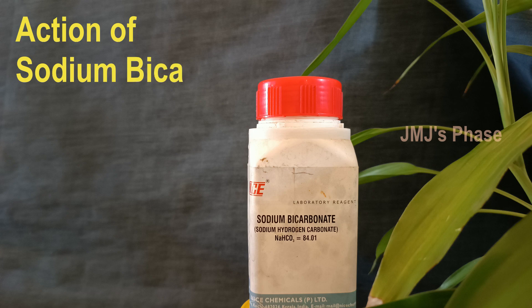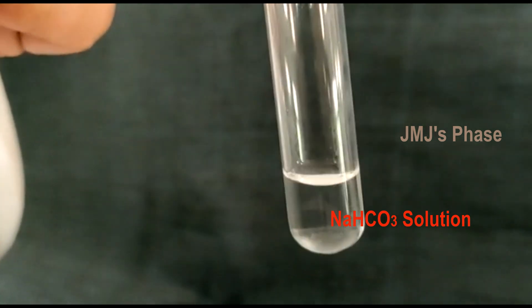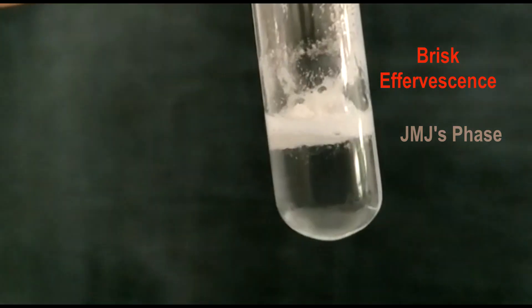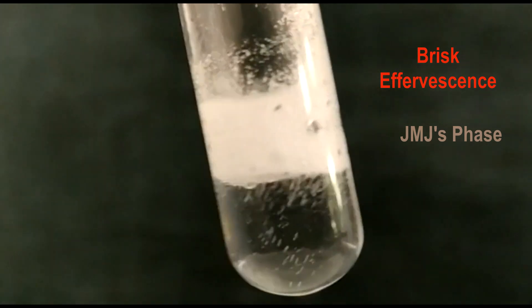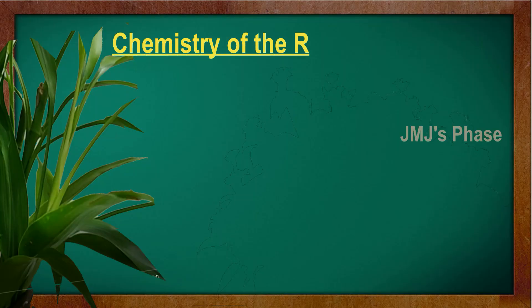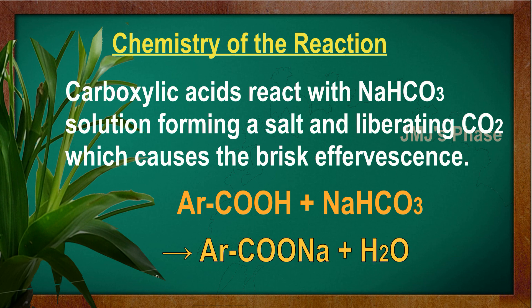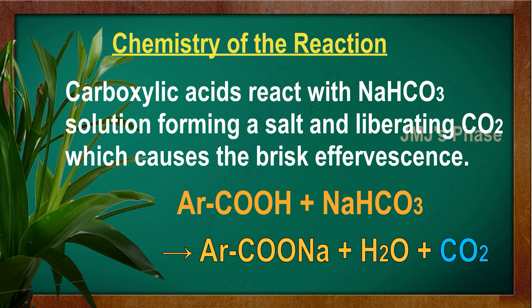Action of sodium bicarbonate: Take 1 ml of strong sodium bicarbonate solution in a test tube and add a little of the organic substance carefully into it. If you observe a brisk effervescence, it indicates the presence of carboxylic acid. The chemistry behind the reaction is carboxylic acids react with sodium bicarbonate solution forming a salt and liberating carbon dioxide, which causes the effervescence.